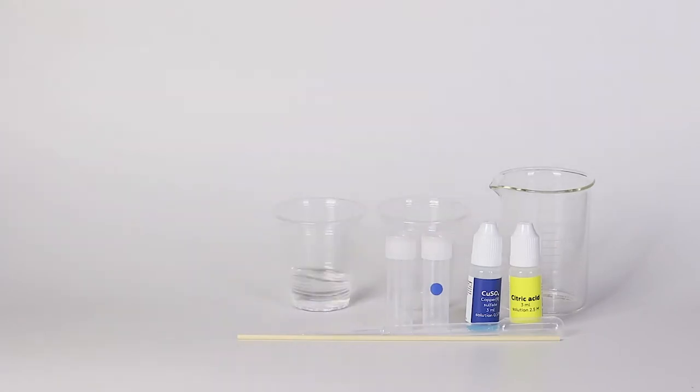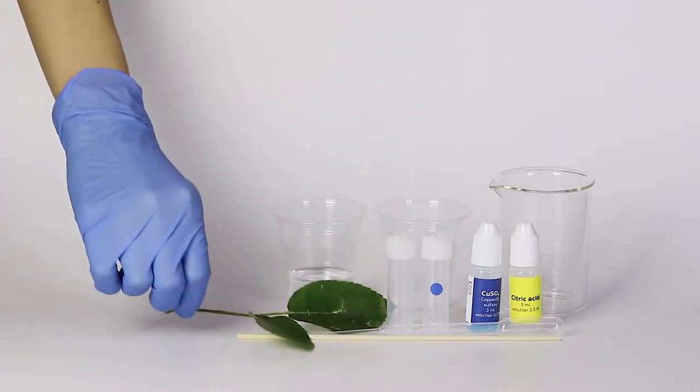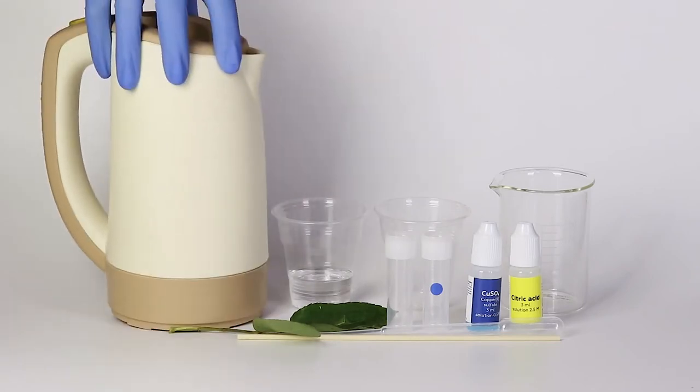Prepare some 96% alcohol, some green leaves, and hot water in advance.